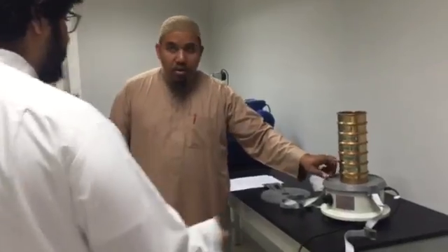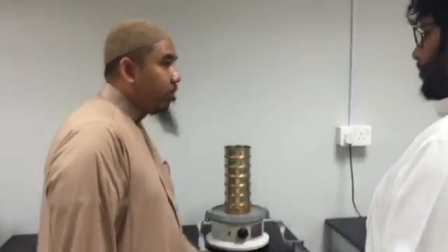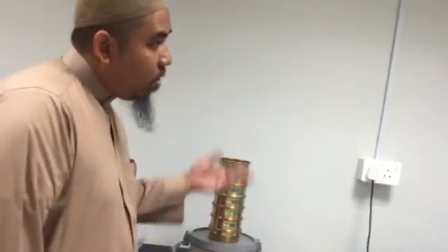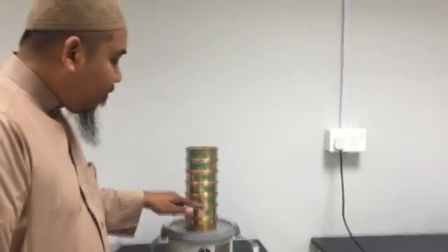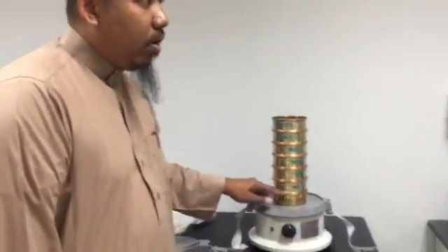So we do it 3 times? 3 times, because you will do it three times anyway. If we do it the first time, do I empty it and do it again? If the amount is enough, you can directly measure the angle of repose. If not, take the last one, this and this, the last 3 smallest particle sizes.